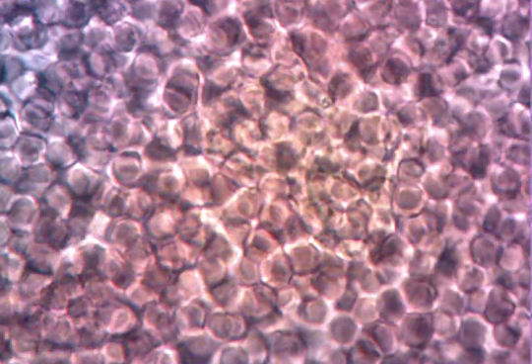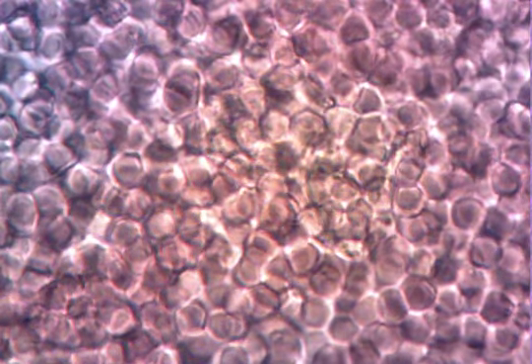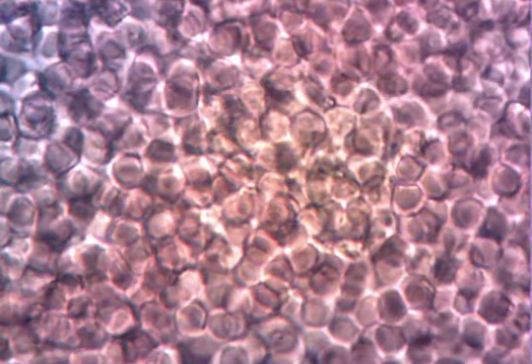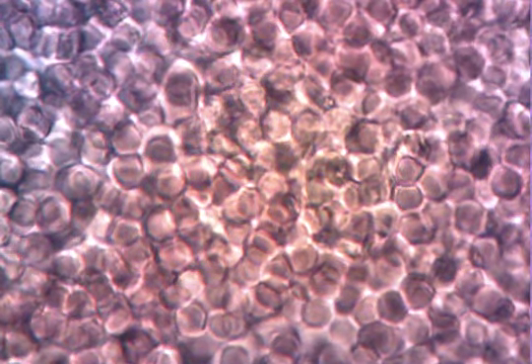So in the last slide, the last video, we took recording of the salt water where the high amount of solute was outside the cell, so all the water exited the cell. In this video, the high amount of solute's in the cell, so you're seeing things fill. And if I left this long enough, you would actually see cells burst. If you injected pure water into your veins, you would see your cells explode.